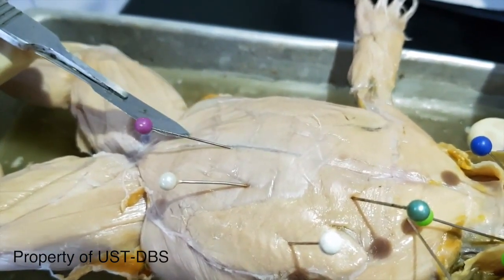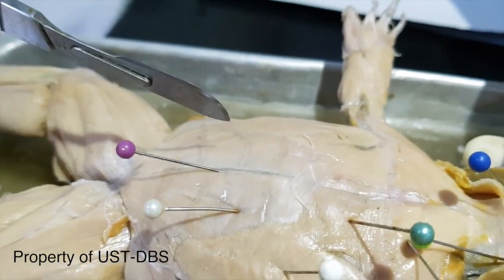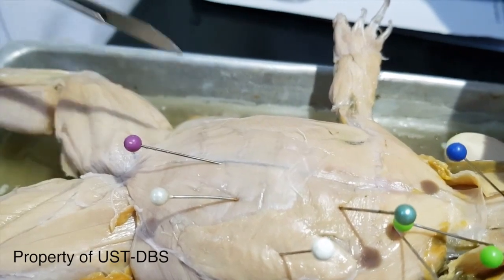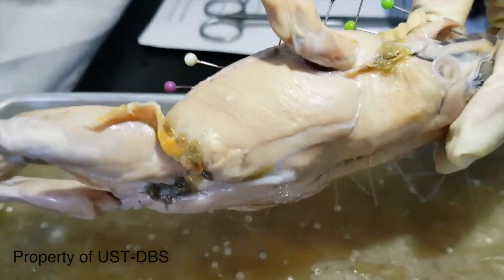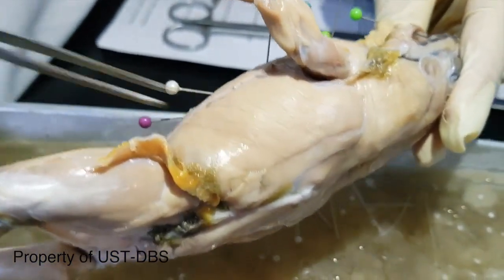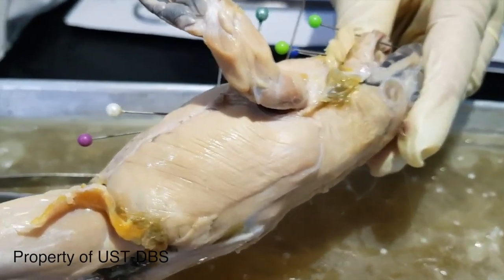It shows metamerism, separating one from the other. The inscriptiones tendineae and linea alba are the origin and insertion of this group of muscles. On the side, with striations that run oblique, is the external oblique.